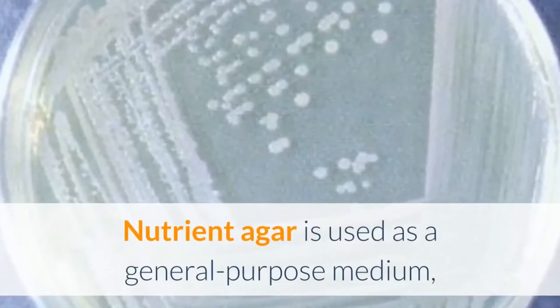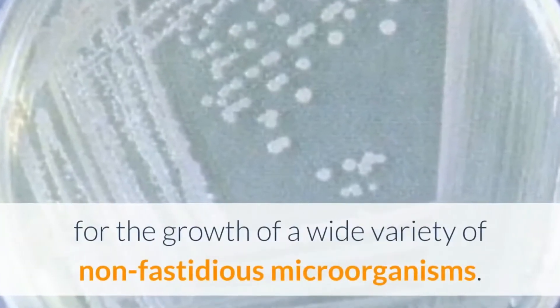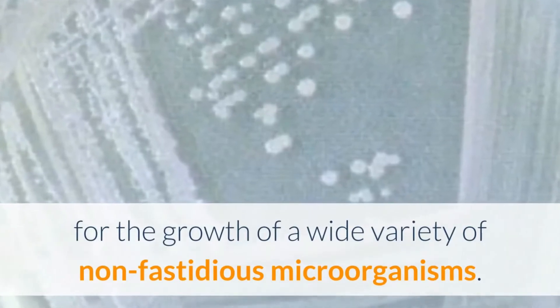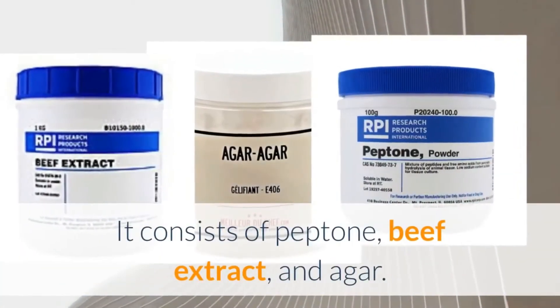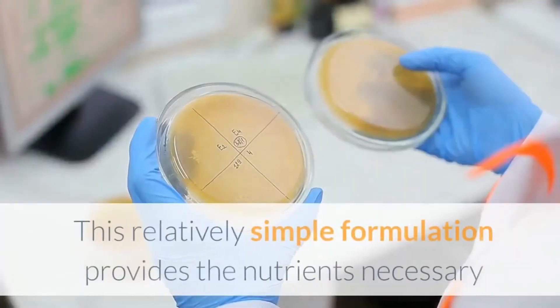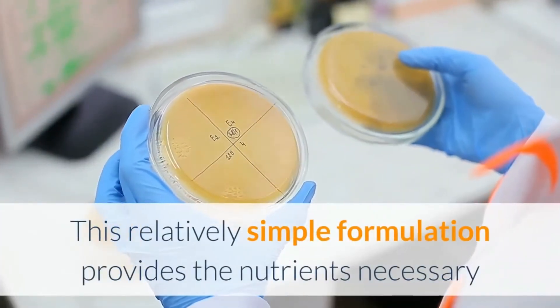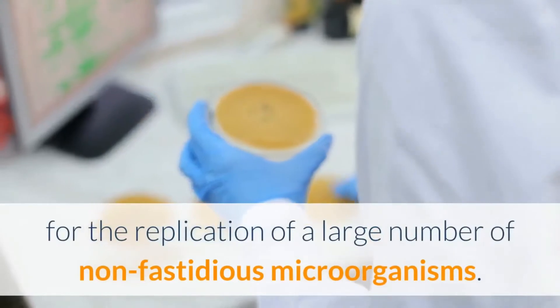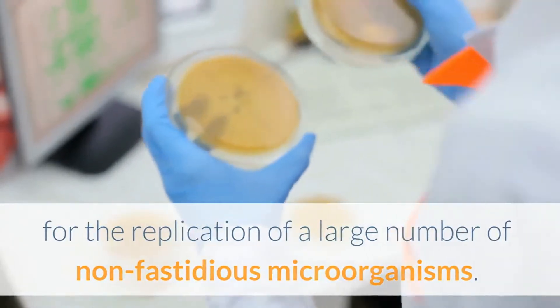Nutrient agar is used as a general purpose medium for the growth of a wide variety of non-fastidious microorganisms. It consists of peptone, beef extract, and agar. This relatively simple formulation provides the nutrients necessary for the replication of a large number of non-fastidious microorganisms.